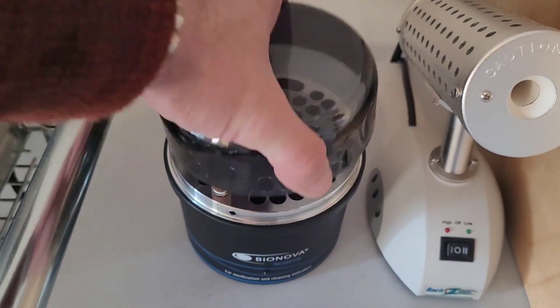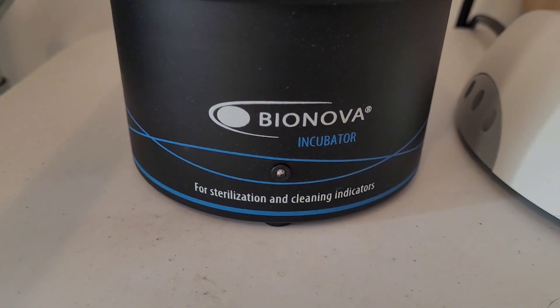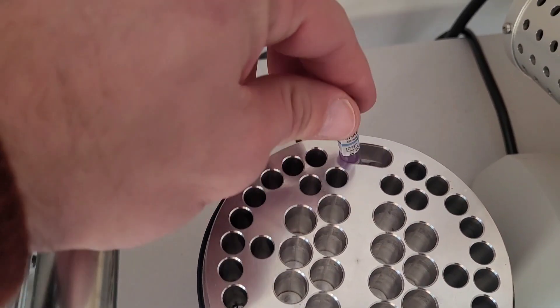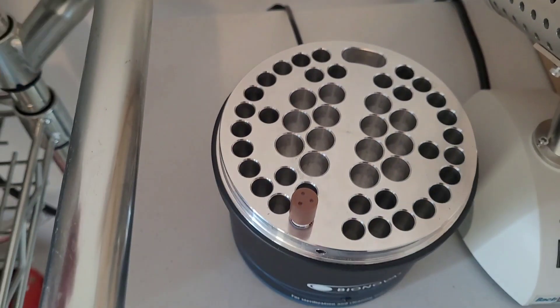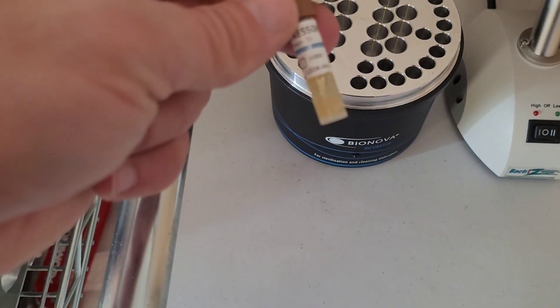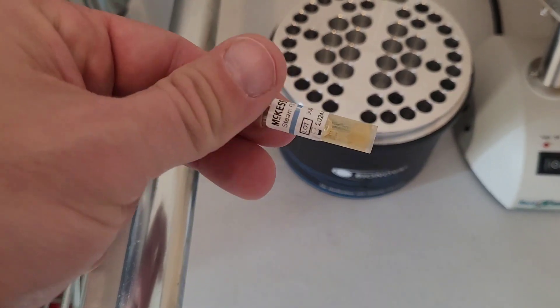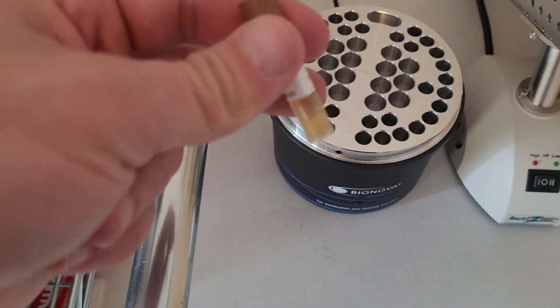The wafer contains the growth medium responsible for the reactivation of the bacterial endospores, should they not be sterilized. The ampules require incubation in an incubator specifically for the small self-contained biological indicators. You place your ampule in the back and crack it like a glow stick. This one has previously been cracked — you can see the color change from purple to yellow, indicating surviving bacterial endospores have been reactivated upon contact with the nutrients.